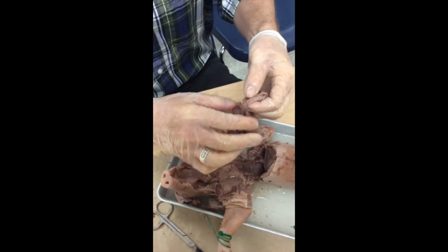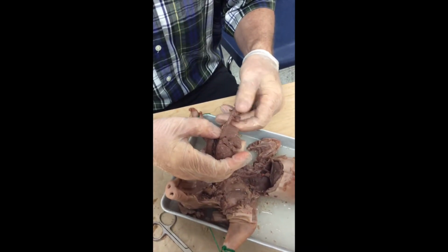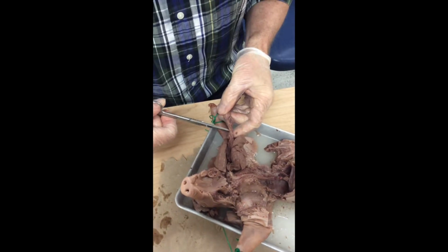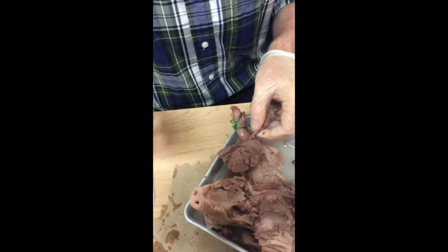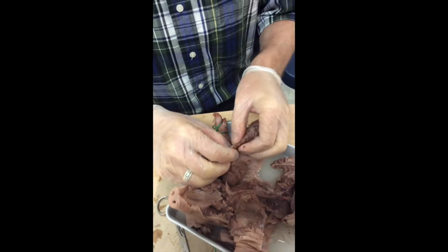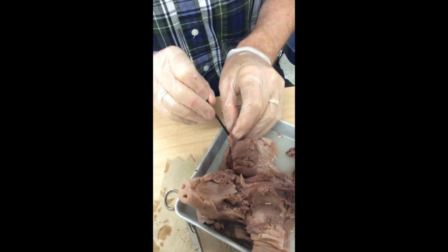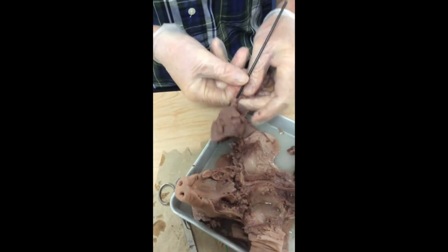I'm going to do something kind of goofy here. I'm going to do a tracheotomy, and I'm going to stick a straw inside there and see if we can inflate the lungs. Sometimes I can. I don't know if I'll be successful on this occasion, but we're going to give it a try. Kind of fun. Black drinking straw here. And I have just entered that into the trachea.